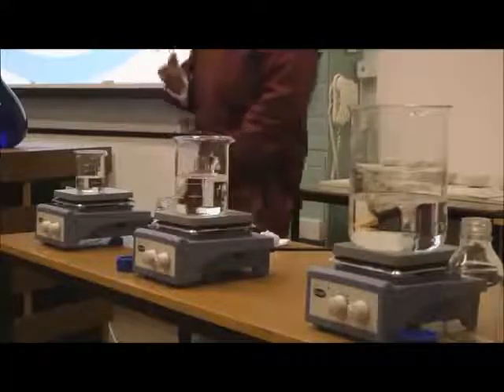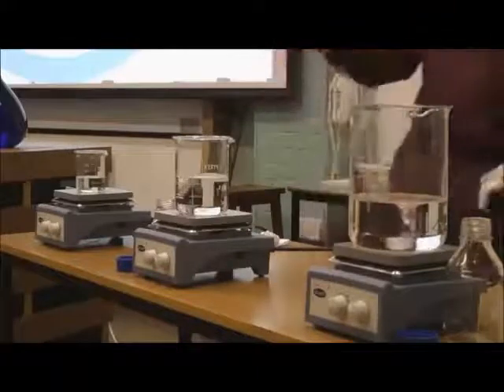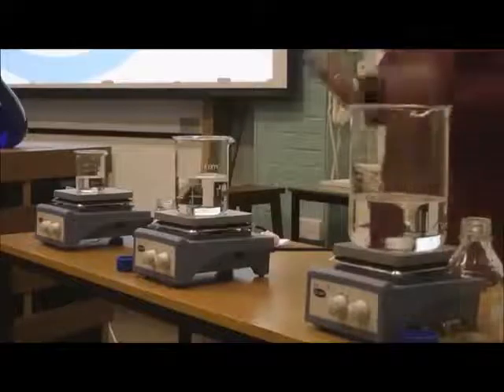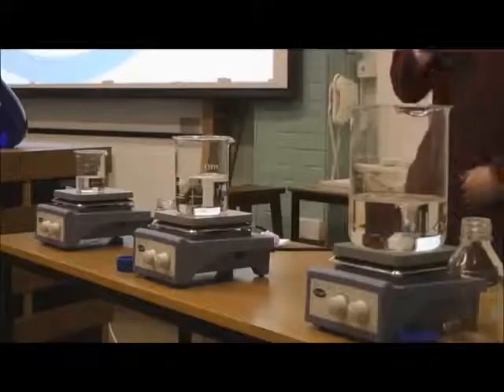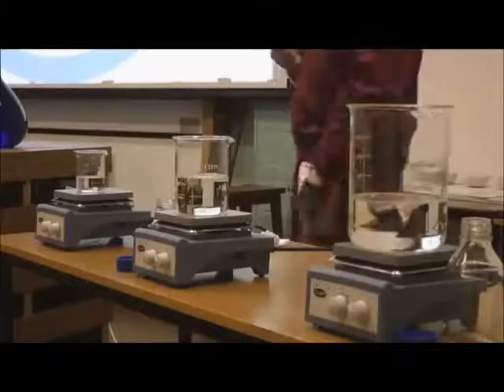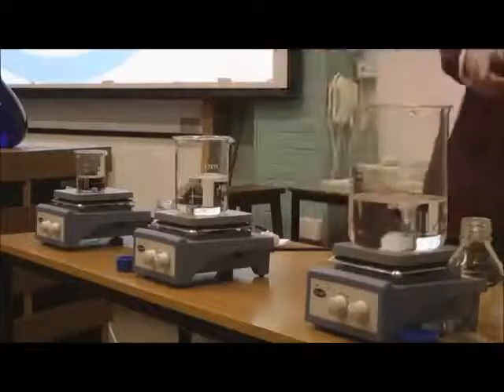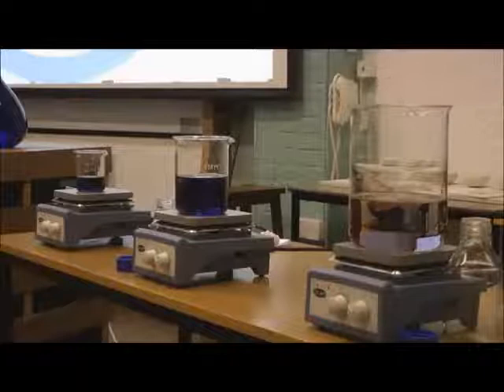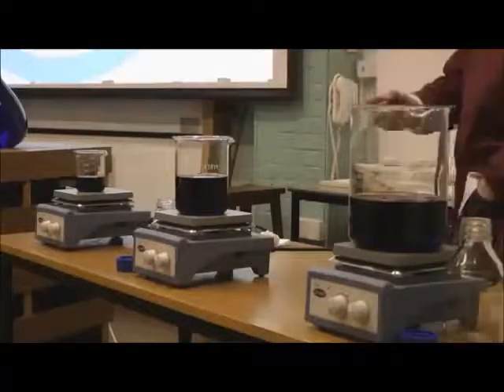When faced with a difference of opinion, you would set up this experiment and run it yourself. So somebody's got 2 different views, we'd run it and we'd see what happens. I've got my fingers crossed that it is going to actually work. And I forgot how long I set it to take. If this one took 50 seconds, if this one's taken a lot longer, it might be 100 seconds to go. 1, 2, 3. And there's some subtlety there.